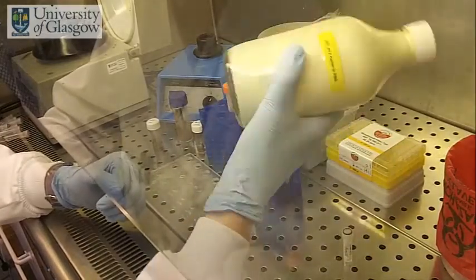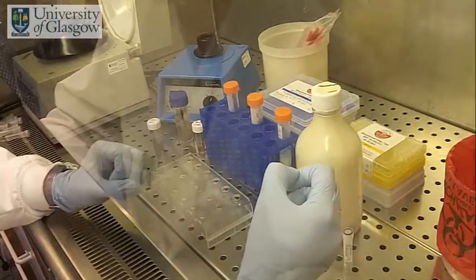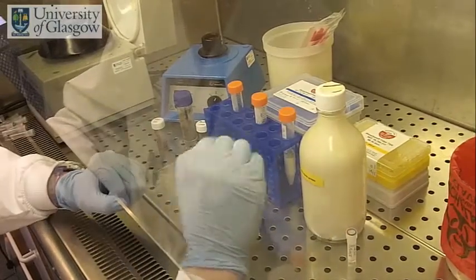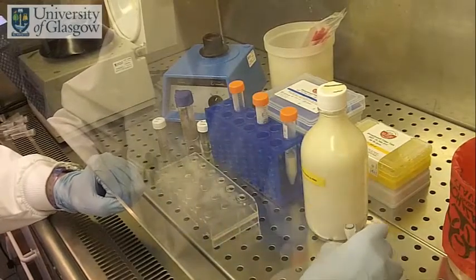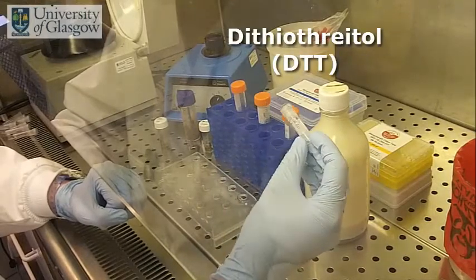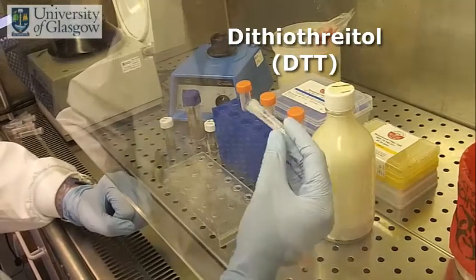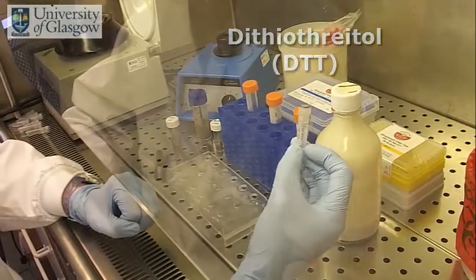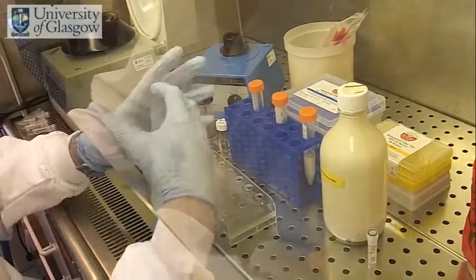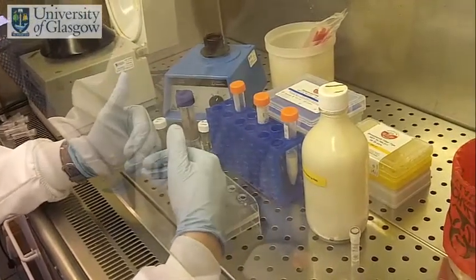To clean up our sample, we use a mixture called kaolin, which is in salt water to make it into a solution. The kaolin itself is a light clay, and it helps us pellet down the solid matter from the fecal sample. In addition to the kaolin, we use a compound called DTT. The DTT's purpose is to break down disulfide bonds within proteins. So this helps us remove large proteins from the fecal sample which may be inhibitory to the PCR, things like hemoglobin, which may cause an inhibition in the actual PCR process.